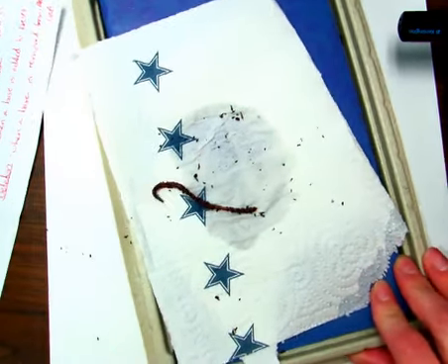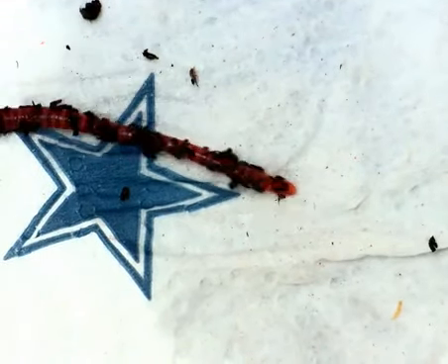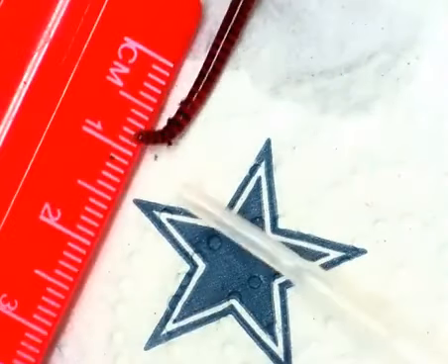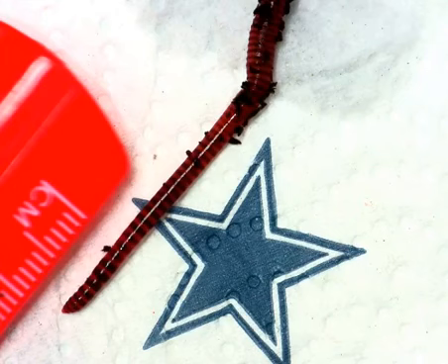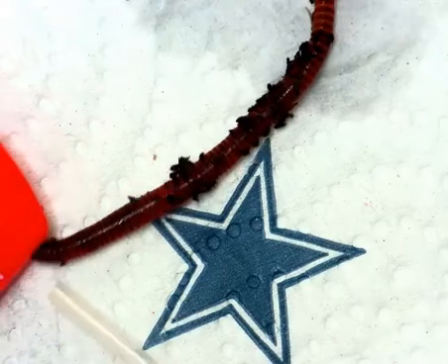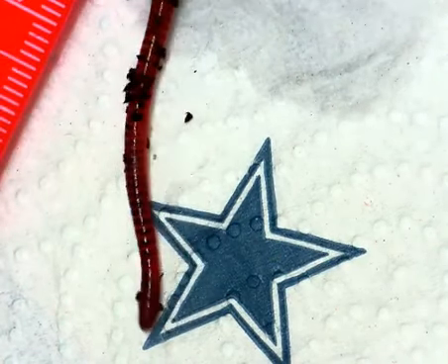Earthworms are segmented worms. Let's zoom in here, and we're going to try to count just the first centimeter's worth of segments. See here, 1, 2, 3, 4, 5, 6, 7, 8, looks like 9 or 10 segments in that first centimeter. Since he was 8 centimeters long, we can assume that he has about 80 body segments.